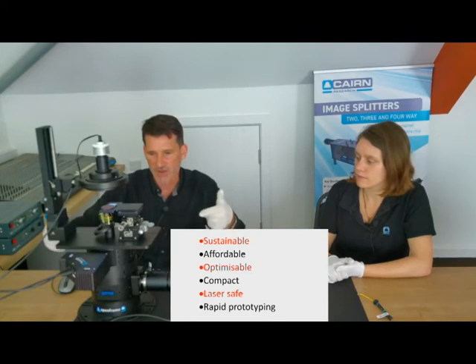It's very compact. Hopefully that's come across in this presentation. One of the key things about the compactness is that it doesn't have a front, a back, or a side. So every layer can be orientated in any of 45-degree positions. Where it's really critical, I think, for saving space in your lab is the fact that it can be built to be wide, where light comes in from one side and out from the other, or some combination thereof. So we don't need any depth.